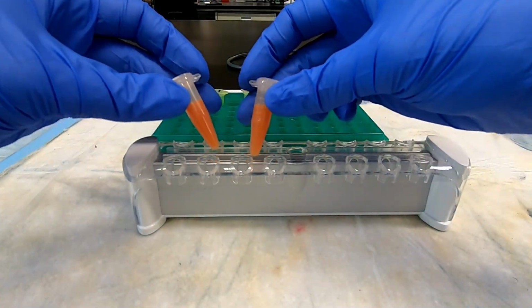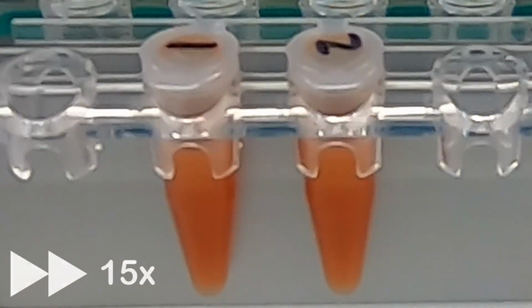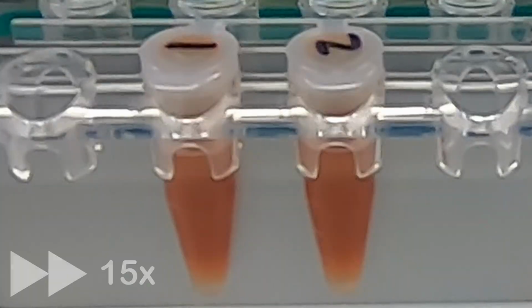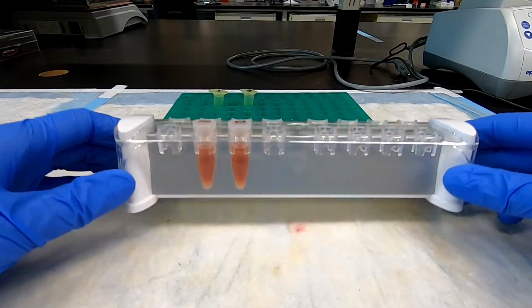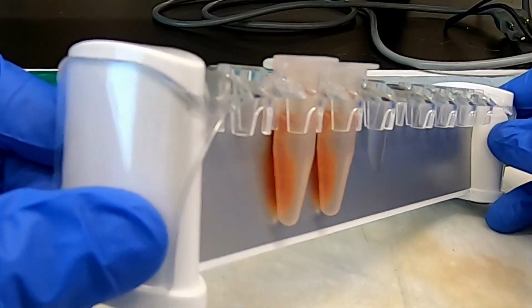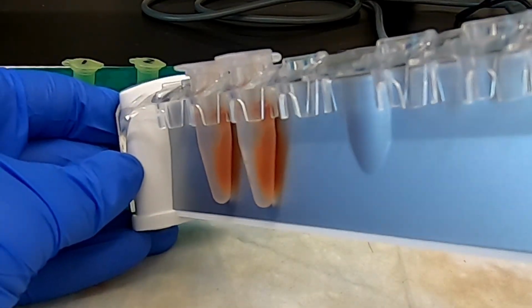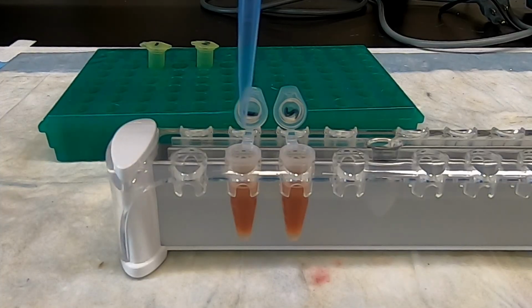Separate the magnet beads again using a smaller magnet rack. The beads will now stay bound to the back of the tube while on the rack. Remove the water.